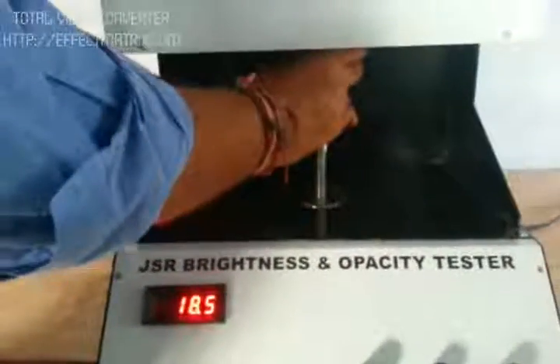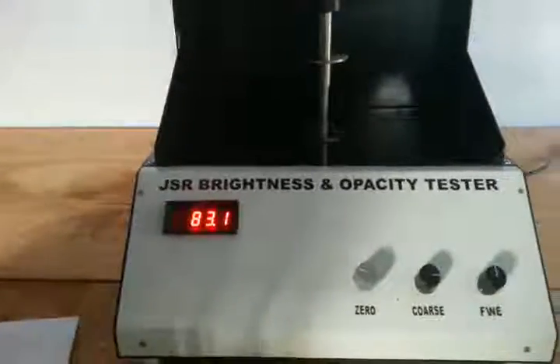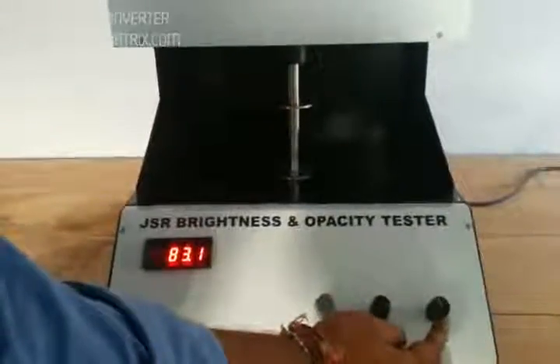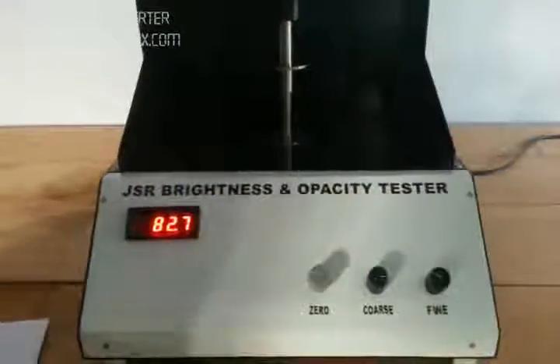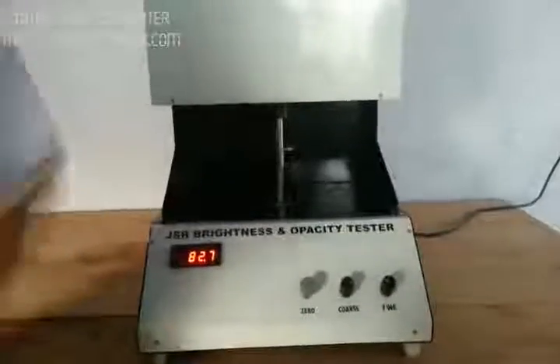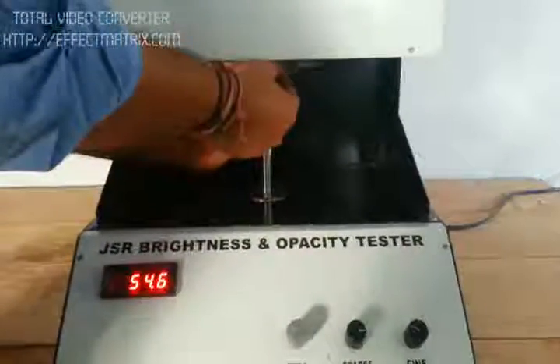Then we place the brightness tile. The value of the tile is 82.8. Once we first place the tile, we set it to 82.8 using the fine pot. Initially, we need 5 to 10 minutes warm-up time for the machine.